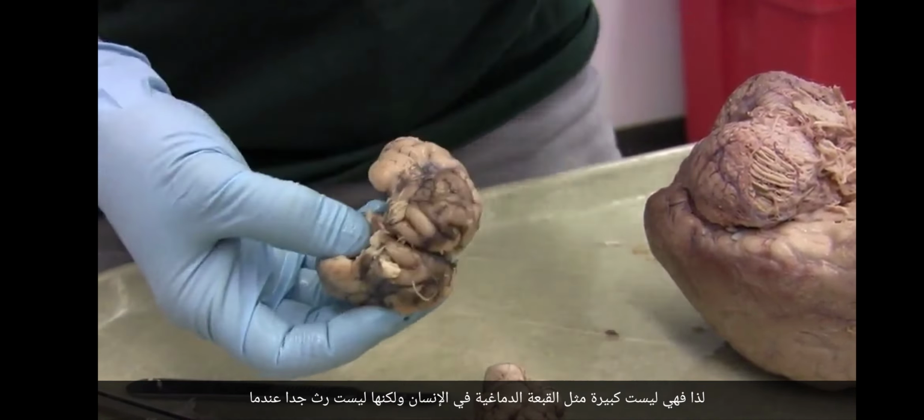We have this, which is midbrain, and this is actually the second really surprising thing that I learned about a sheep. Look at this structure. This structure is the superior colliculus. We're going to just look at a superior colliculus in a mid-sagittally cut human brain.